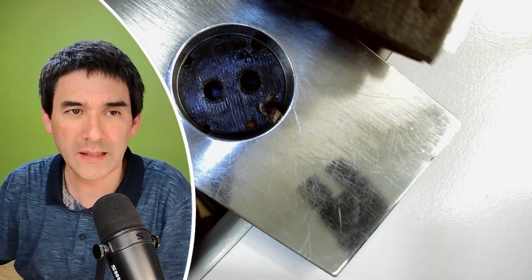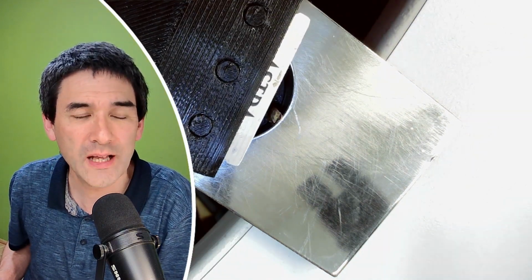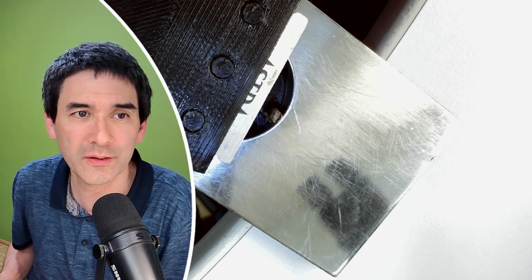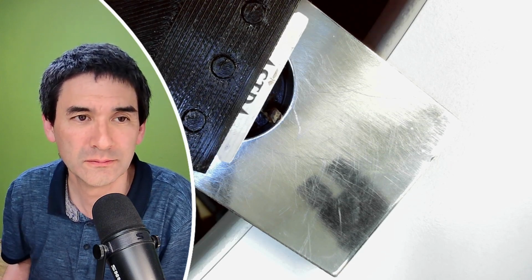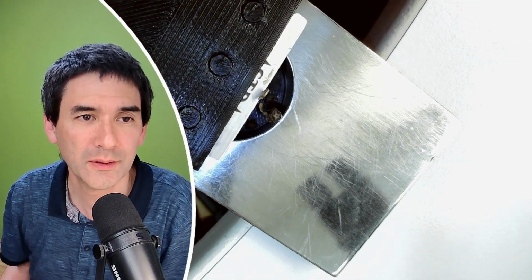Yeah, and last but not least, let's try this one here. This one actually has the advantage that I'm able to put it directly very flat on the microtome. So, one.